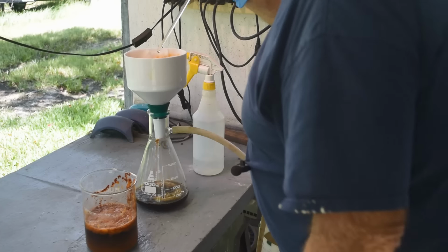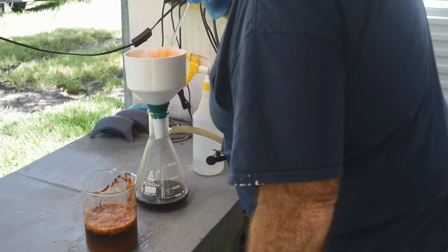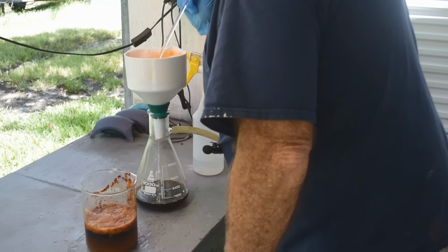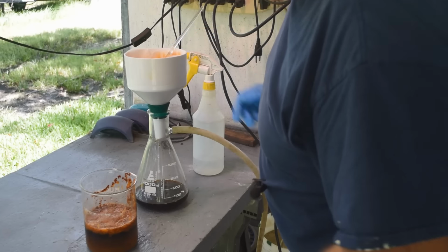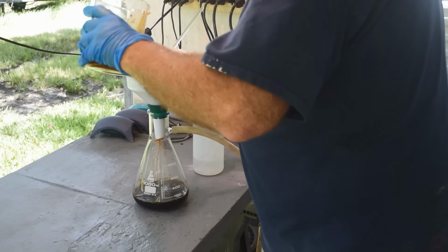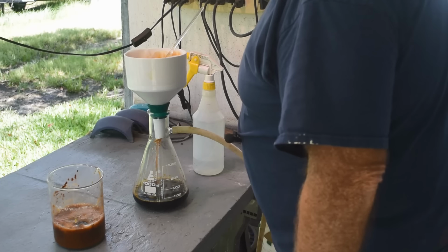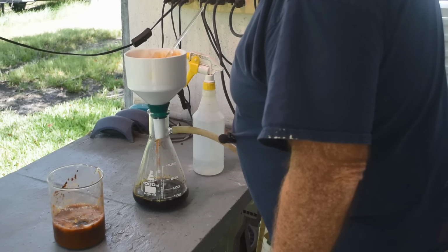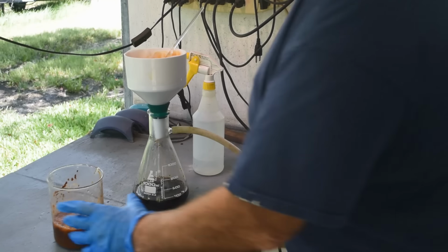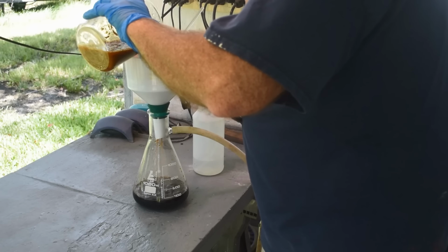Uh-oh. I think, did my filter fail? That came through awful darn quick. I don't know if my filter failed or what. I don't see any holes in it. Guess it's okay. Let's see if there's any debris in it. If so, I guess I'll have to filter it again.